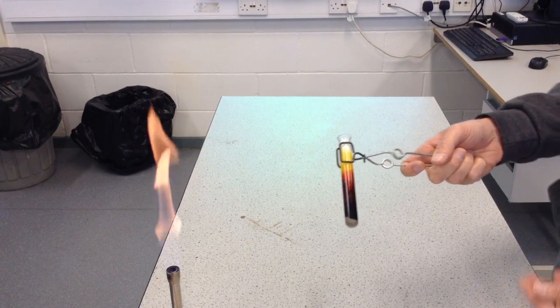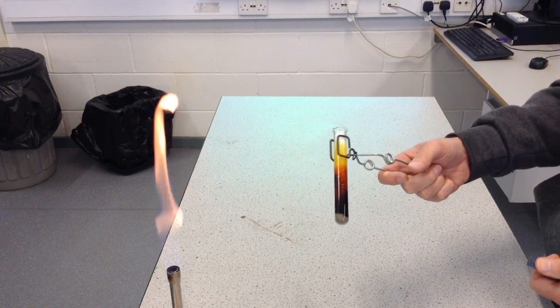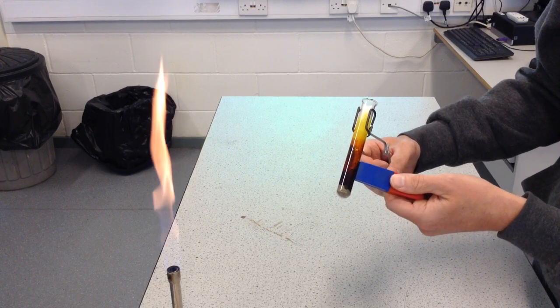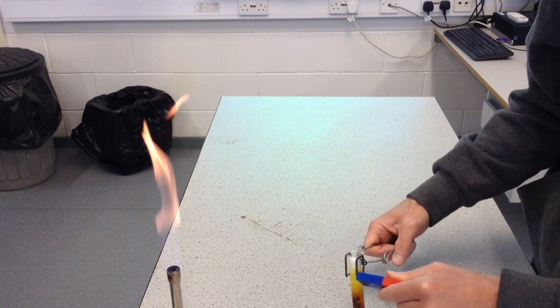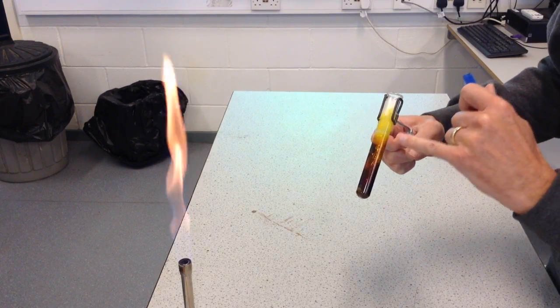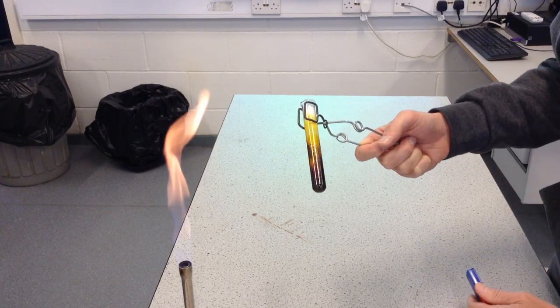The thing about compounds is that those two atoms have chemically joined together. And because they've joined, it should now be very, very difficult — perhaps even impossible — for me to separate the iron from the sulphur. They have chemically joined together. If I use the magnet again, I shouldn't be able to separate the iron and sulphur anymore, because they've joined together. Some of the sulphur has come and stuck itself to the top, but I can't separate the two. Essentially, it's become one solid lump of iron sulphide.